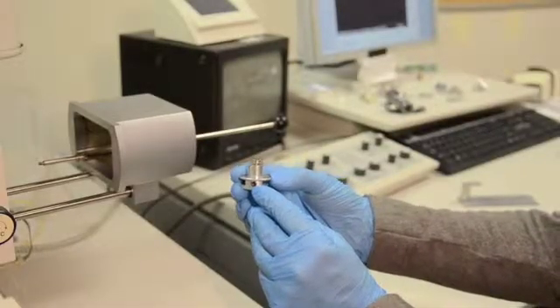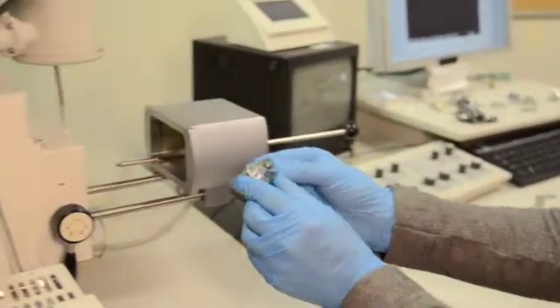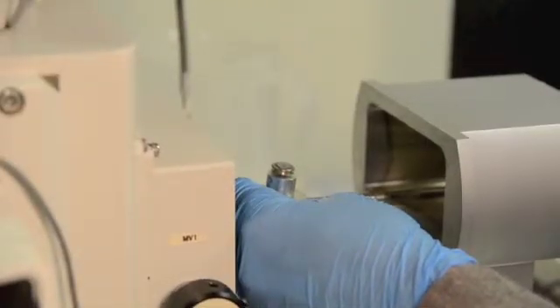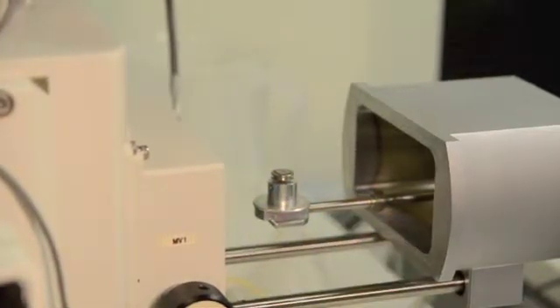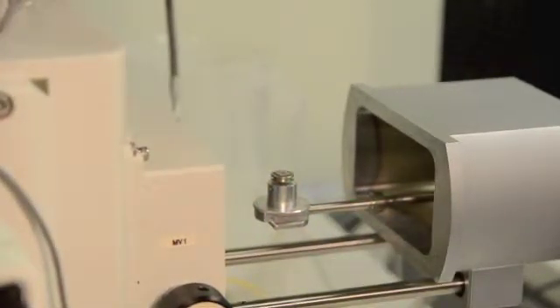Pick up your sample that has been mounted onto the SEM sample holder. Locate the threaded mount and screw the exchange rod onto the sample holder until it is finger tight. It is very easy to damage the rod or sample holder, so be very careful at this step.